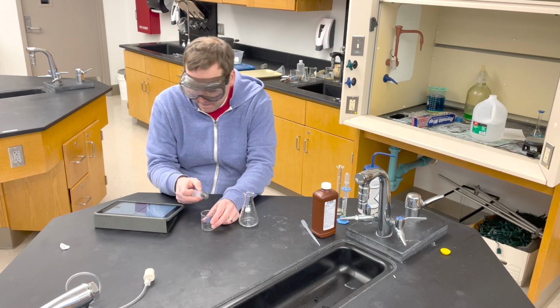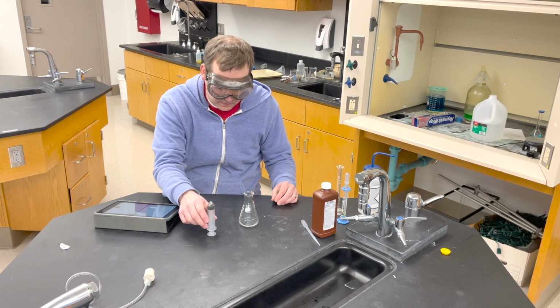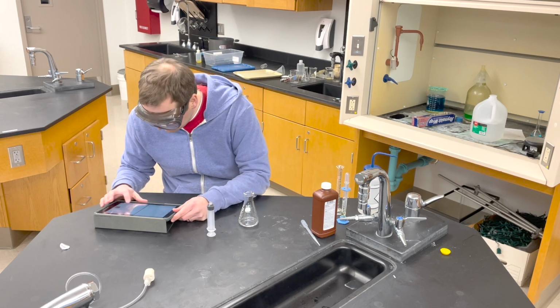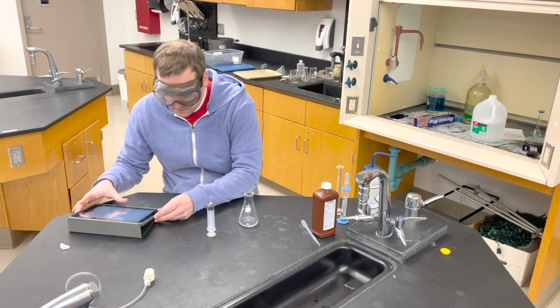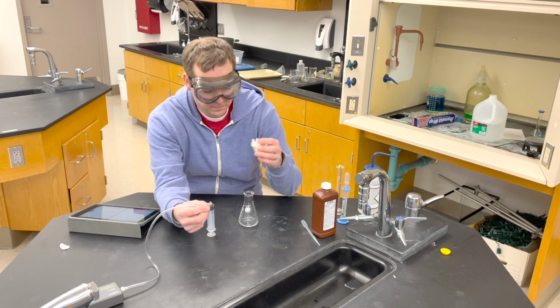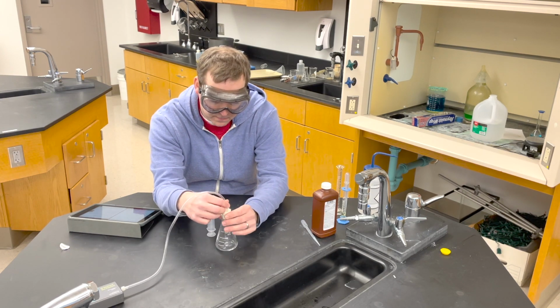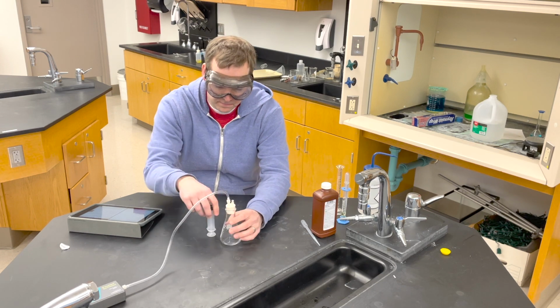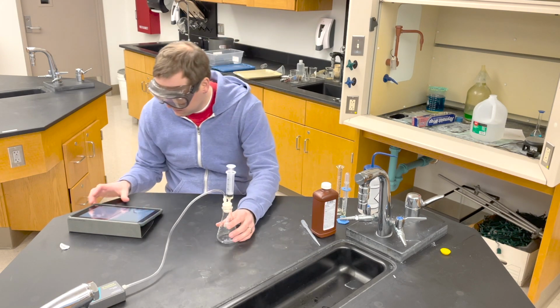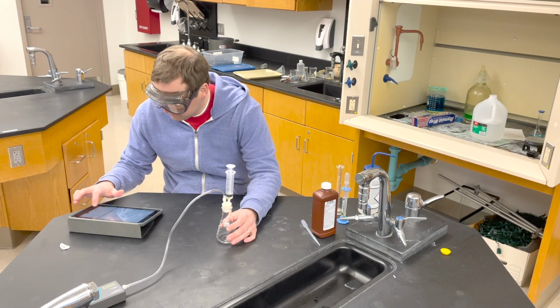Once I'm satisfied that I have exactly 2 milliliters, I set the remainder off to the side for the next part of the experiment. Next I gotta set up my Erlenmeyer flask with the stopper and the rubber tubing, and I also need to connect the syringe in because everything connects on this top little rubber stopper. So I connect the tubing, which is connected on the other end to the gas pressure sensor. Then I connect the syringe by giving a little screw into the top, and now everything's sealed up nice and tight.